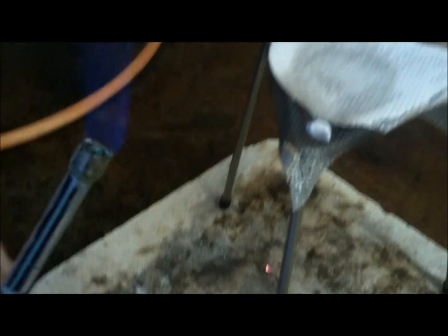So you're burning it. This is a limestone chip on a hot Bunsen burner.